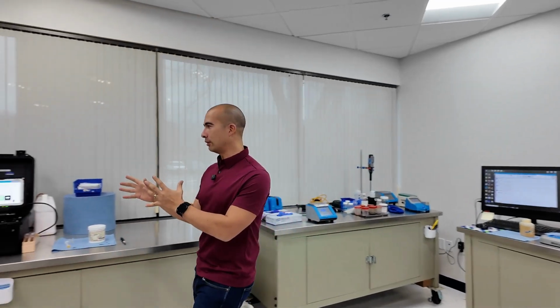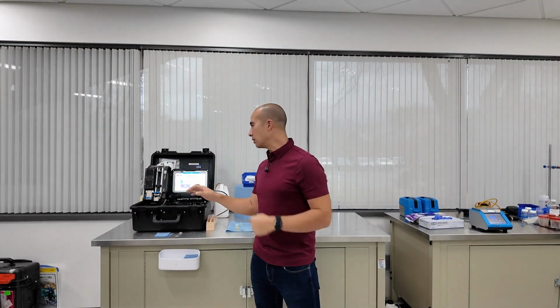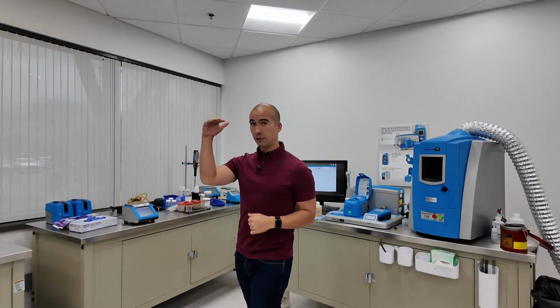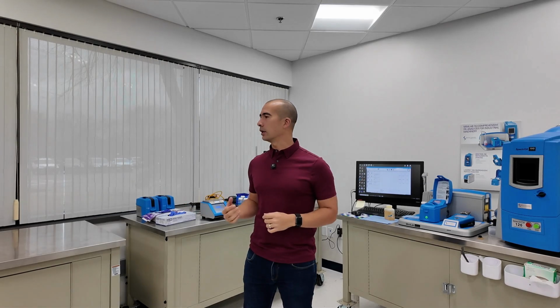These are kits that you can either take into the field. This would be an example of one that you would potentially have actually next to a piece of equipment, versus something like this, which you would set up as a lab on site, right? So that's kind of level number two. Level number three is where you go into what you might term the traditional oil analysis, which is us taking samples and then sending them off to the lab. And then level four is probably that next level down, which is what you might term exception testing. So still done in a third-party lab, but we're doing more investigative type of work, right? So that's where this all kind of fits in.